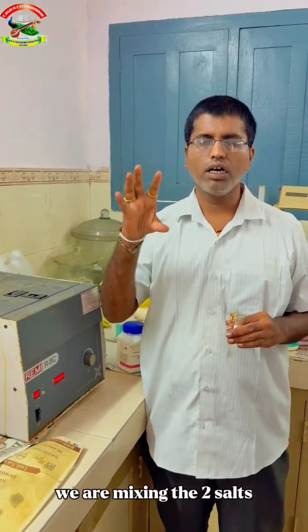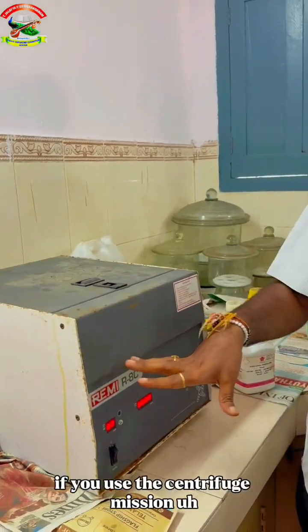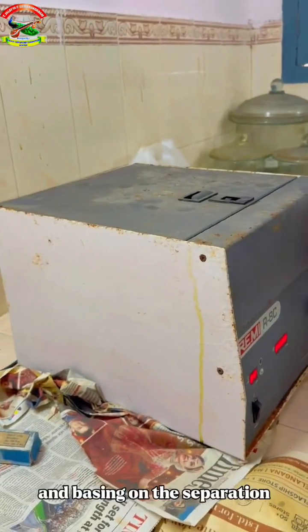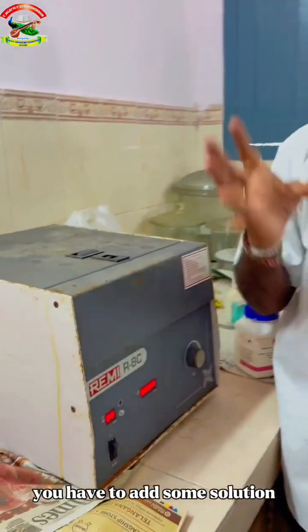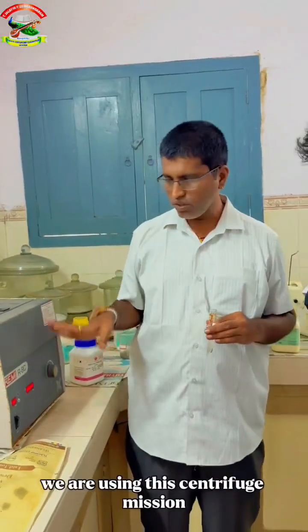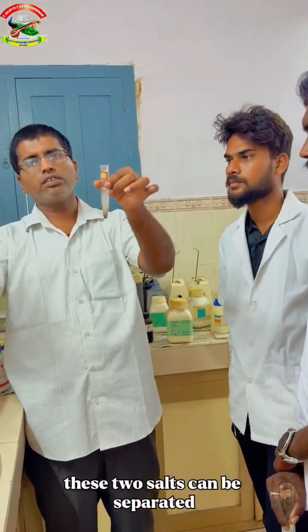We are mixing the two salts, and based on the density principle, if you use the centrifuge machine, the two substances will be separated. Based on that separation, you have to add some solution and confirm that the particular ion is present in the solution. For the centrifuging purpose, we are using this centrifuge machine. Based on the density principle, these two salts can be separated.